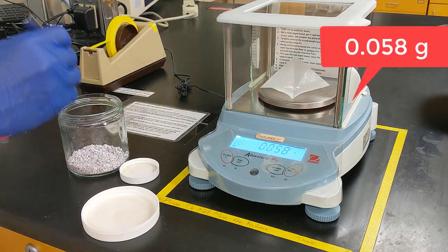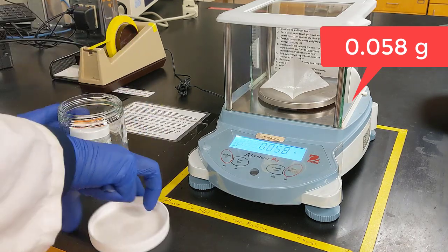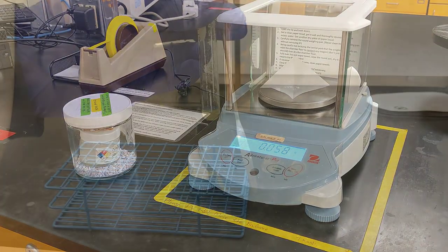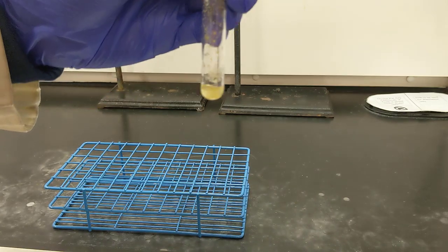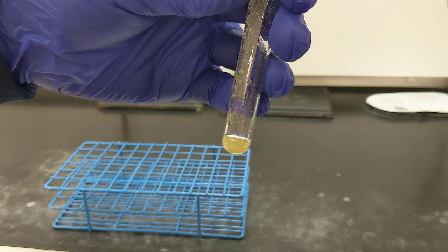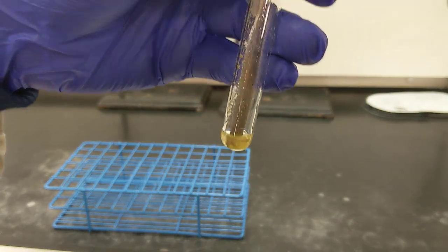Looks like we're already there. So I'll go ahead and transfer this over to my test tube really quickly. Alright, so I just added the sodium hydroxide to my test tube. Now what I need to do is continue mixing the contents of the test tube until it becomes kind of this solid goo. So I'll go ahead and do that, and then I'll show you the final product here in a second.